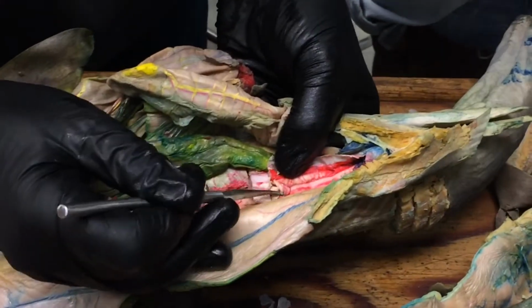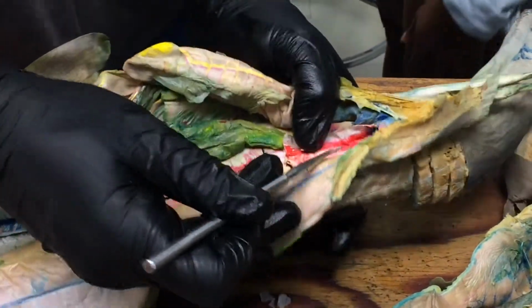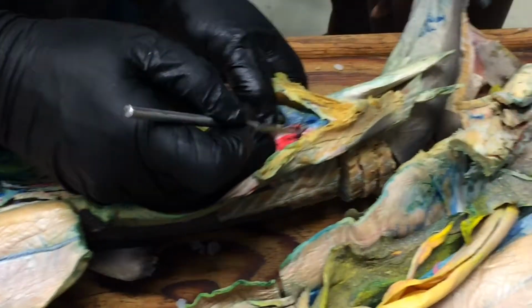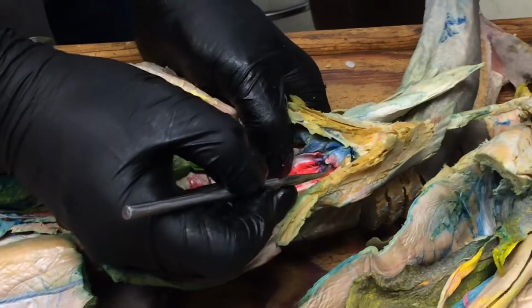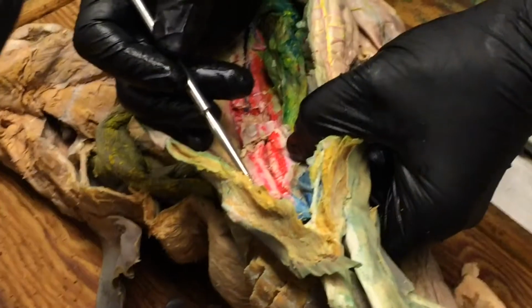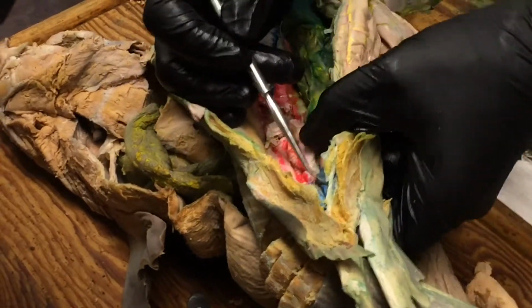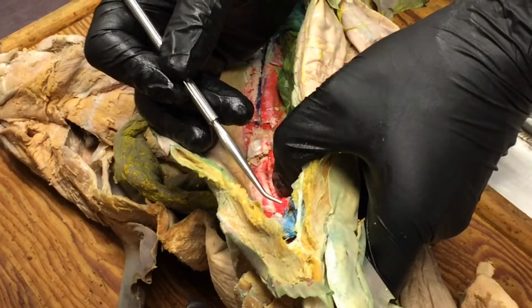And maybe even get a probe inside of it. That might be too much to ask, but it's this whole thing here. That's seminal vesicle. And if we follow that back further, you'll see there's another sac that sits on top of it right here, kind of like a little pouch. And that is the sperm sac. Okay, so here's seminal vesicle running along this big pouch here, very broad in part of the archinephric duct. And then that's the sperm sac that sits on top of it there.